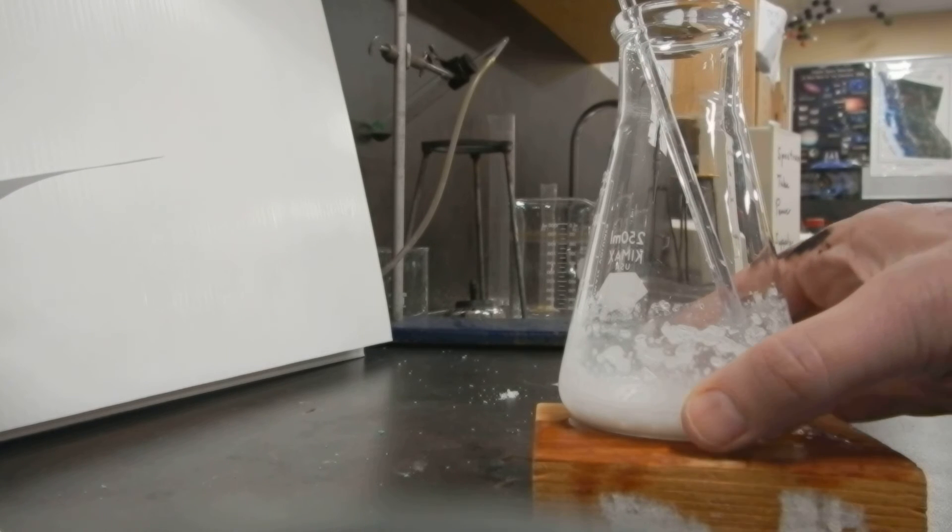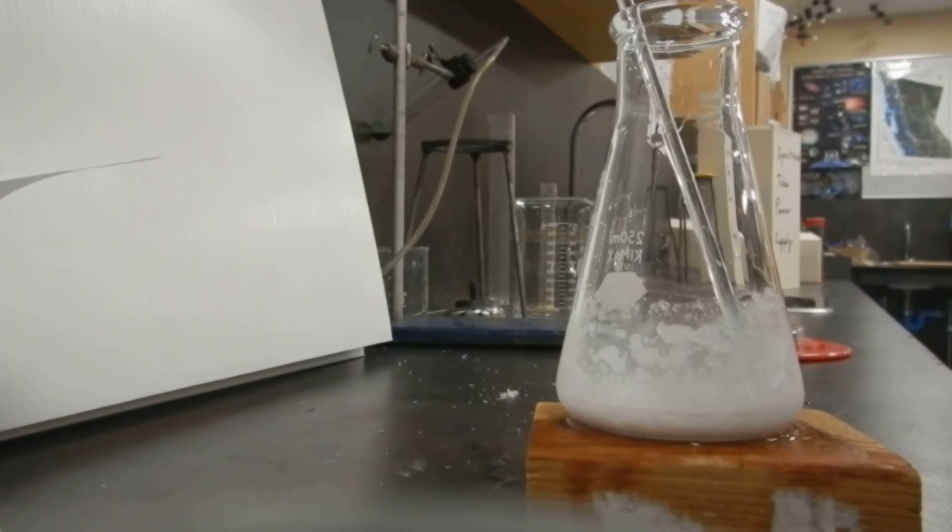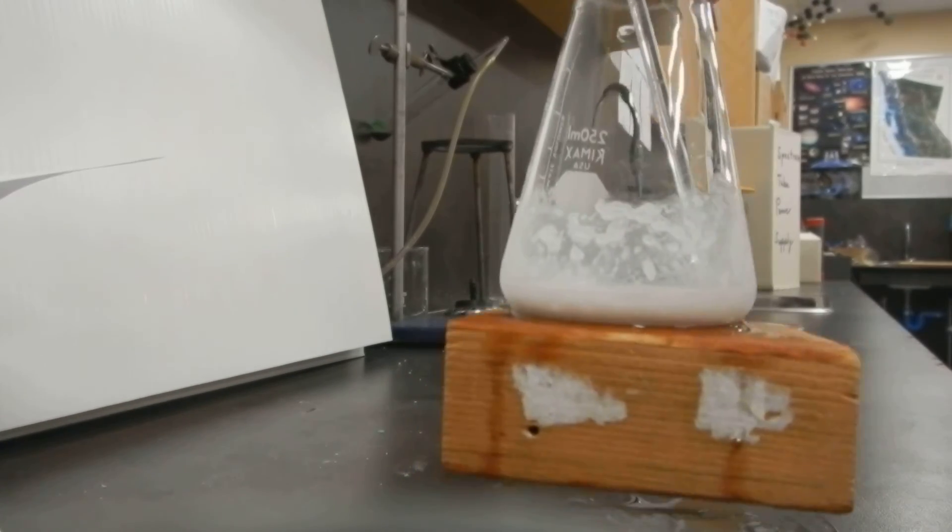So I'm not using the thermometer here. It's just very, very cold. So we know we're below zero Celsius, probably quite a bit below.